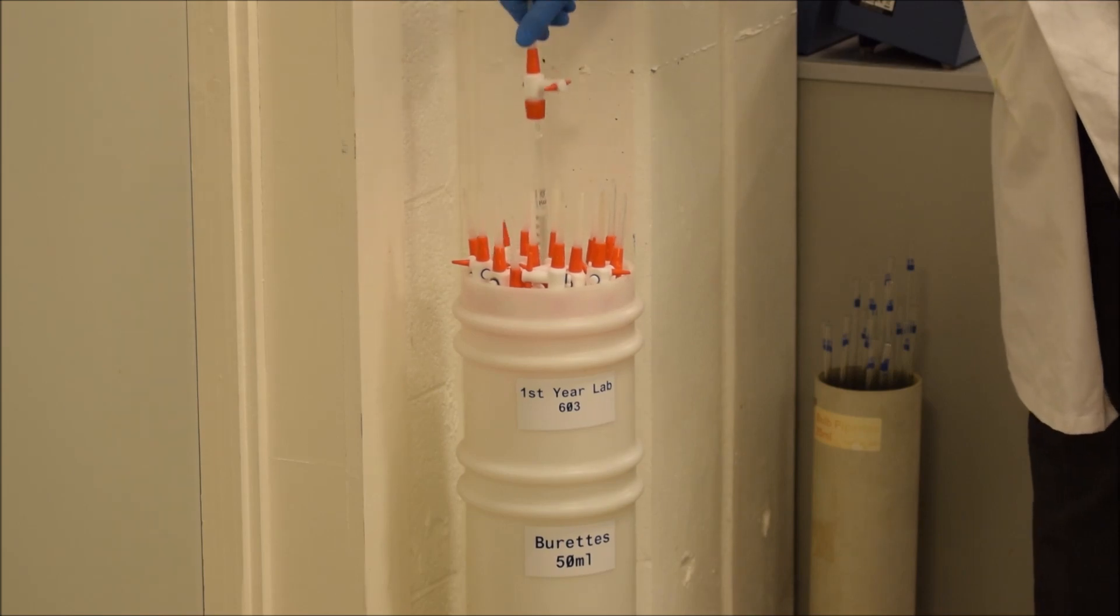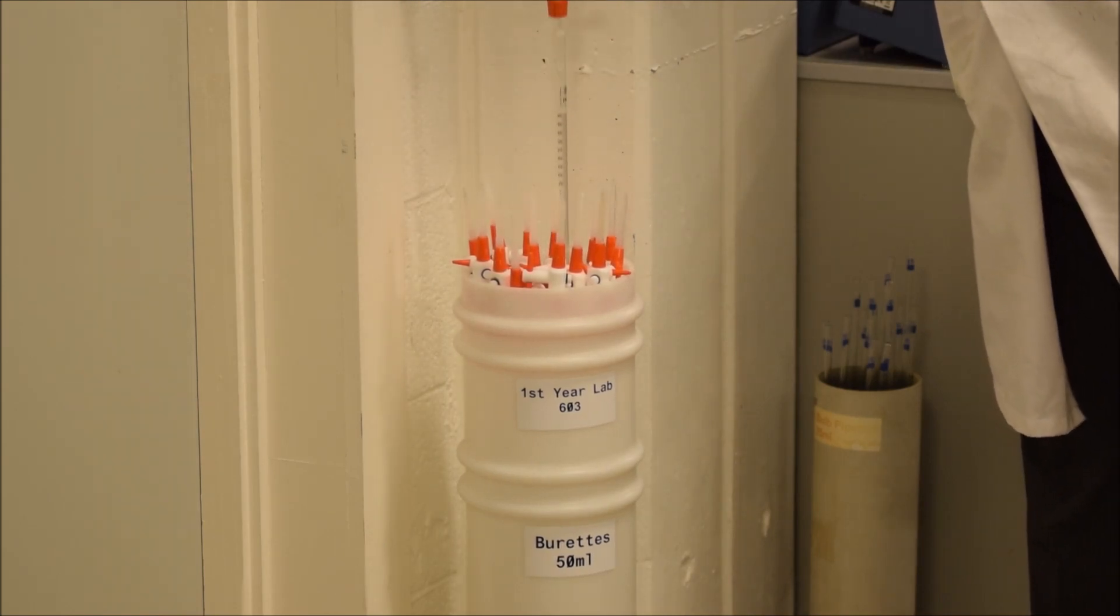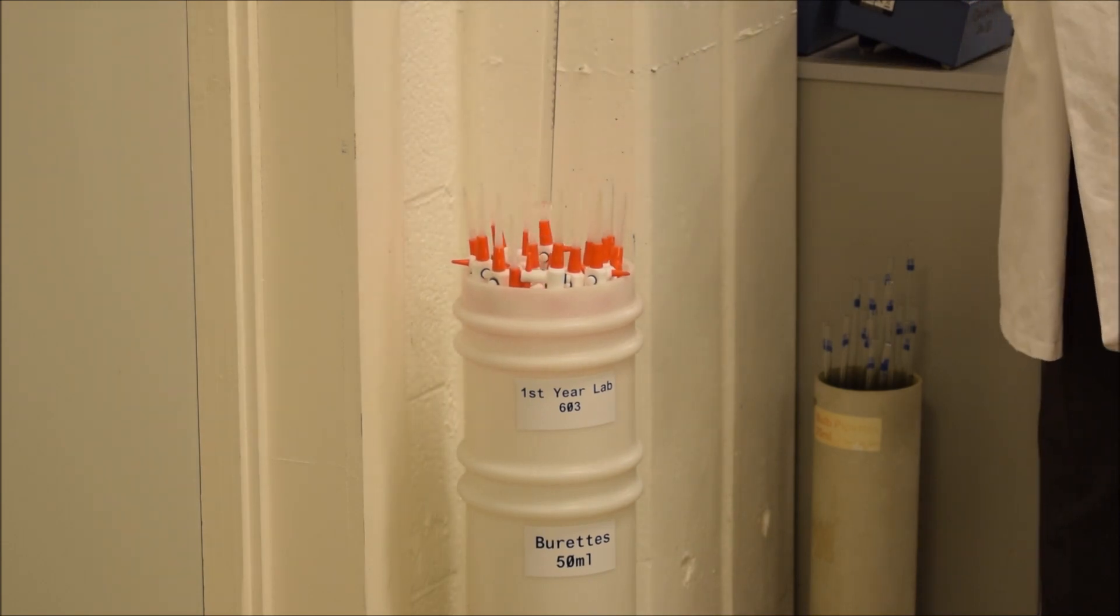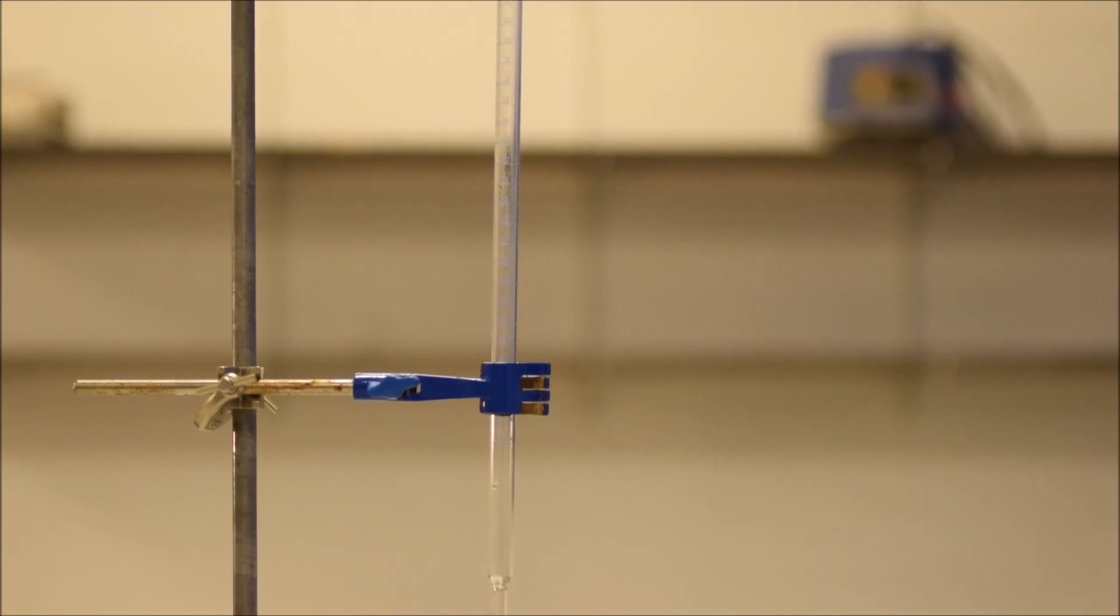Okay, so once you've decided which burette you're going to take, although they're all identical, take it out, and let's see what you do with it. So let's take this burette, and we're going to put it on the bench, and we're going to clamp it.